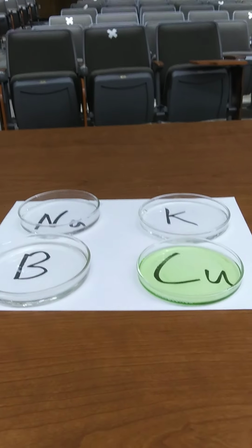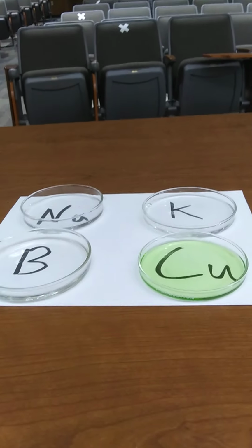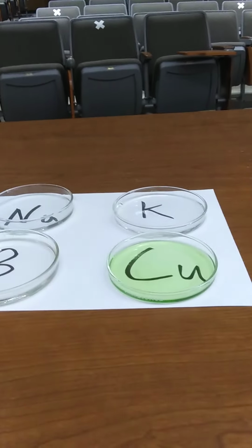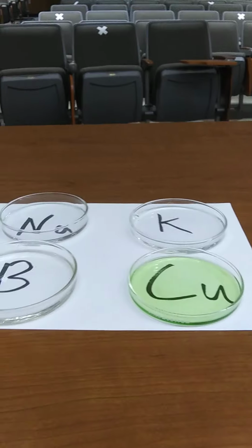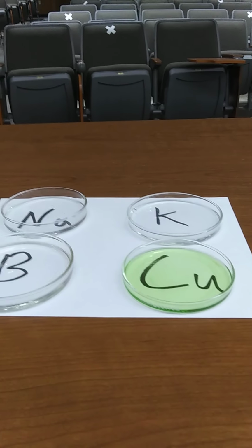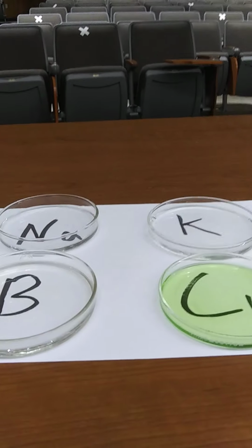If any of you become high school chemistry teachers, make sure that you talk to me before you do this. I'm on a chemistry education listserv. This is the number one demo where accidents happen and people are hurt. So the most important thing if you do this demo is these are solutions in methanol. The reason we use methanol is when it burns, it's not emitting light that we can see, so it doesn't interfere. But the problem with that is you can't see whether it's on fire or not.